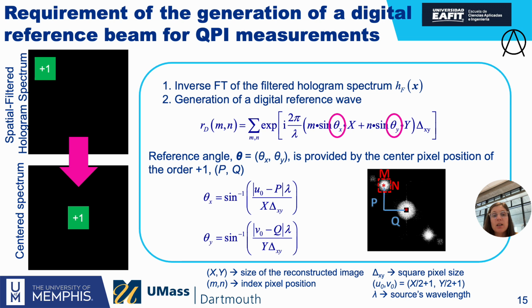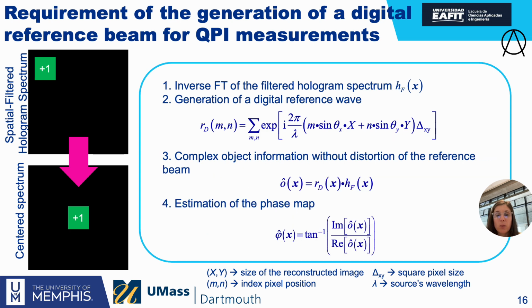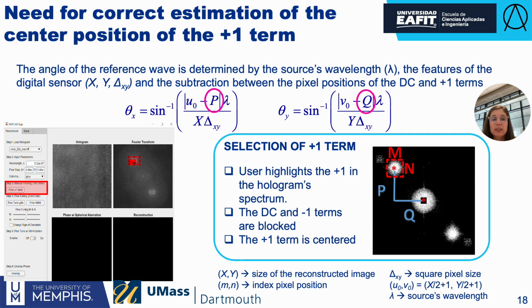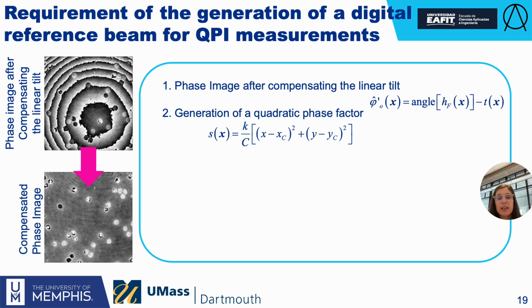So the digital reference is easy. We just need to do the angles, and for the angle we just need the center of the plus one term, so the P for X and Q for Y, and that's how we can compensate for the angle. And when we are doing the centering here, this is our plugin. We can select where the crop is, and then you say where the middle is right here, and that's how we're going to compensate.